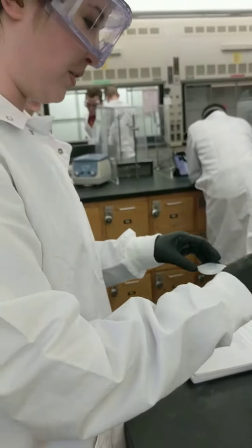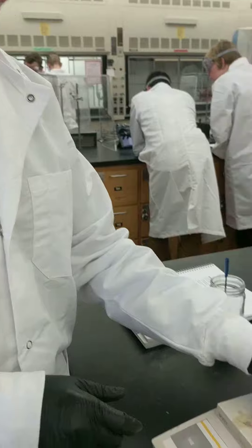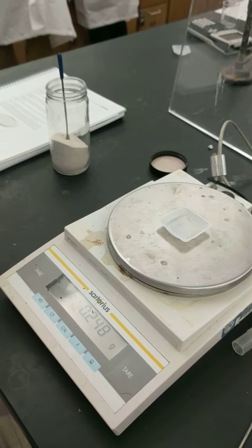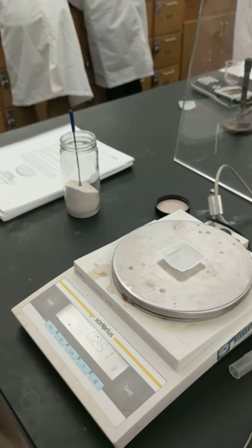How perfect are you? Just keep trying until you get the number that you want, and now I'm at 0.25 grams.